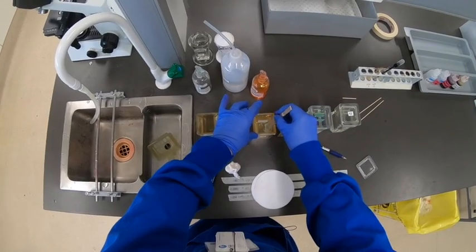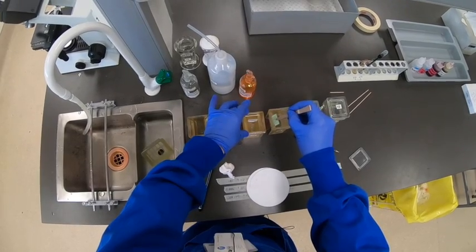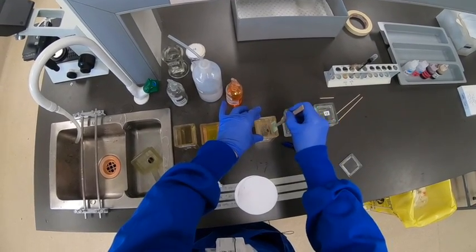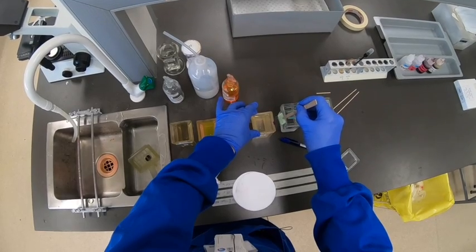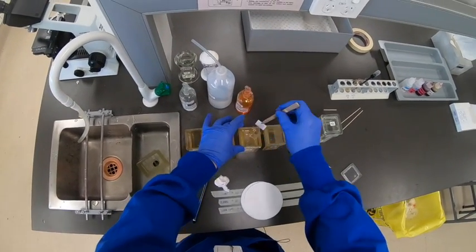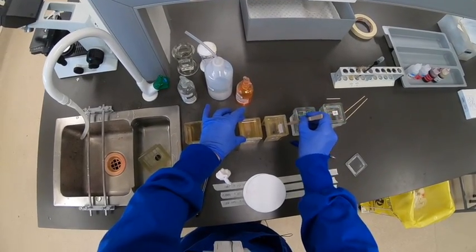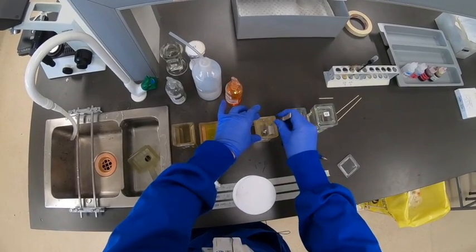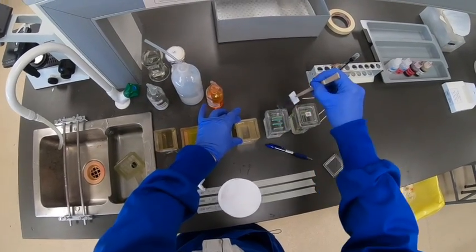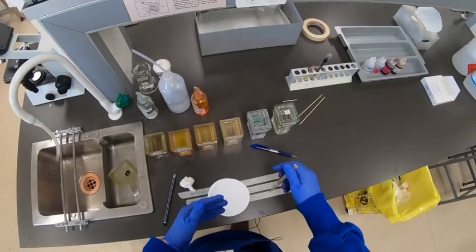Grab the first slide again, rinsing the forceps as we go, then through to the next higher alcohol level to make sure the slide is thoroughly rinsed. A tap on the side so you don't bring too much alcohol through, and then into the final absolute alcohol. Tip off the excess, then through to the xylene. Let that sit for about a minute, then transfer to the final xylene, and then it's ready to be coverslipped.